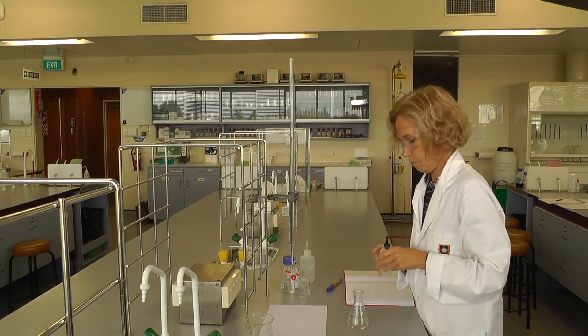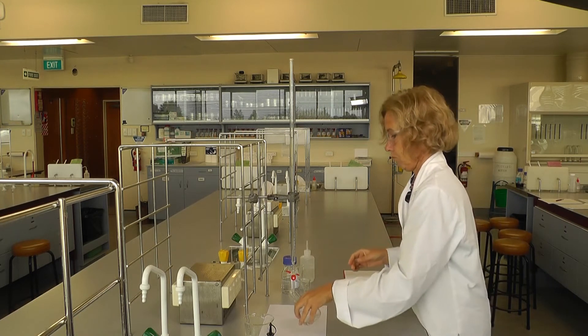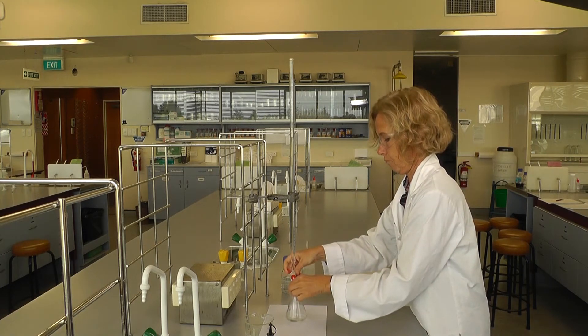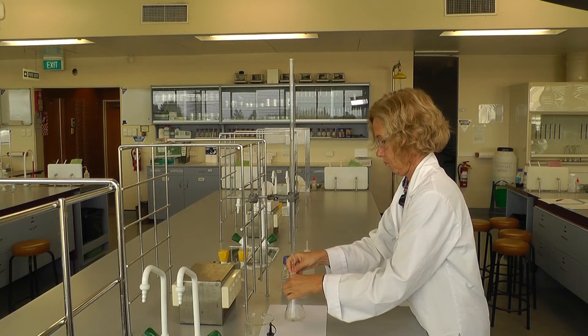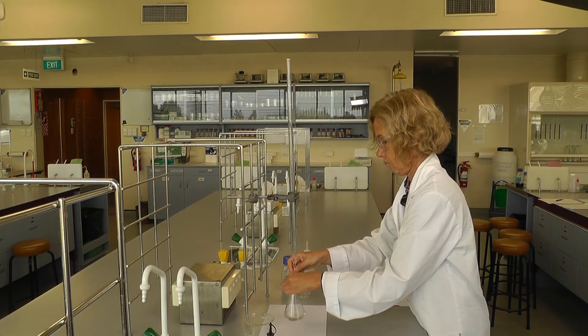A titration is a very precise analytical method and gives a very precise result, so it requires care throughout the process. Because of this, it is important to have a well-organized workspace and clean glassware. It is also vital that you are paying full attention.